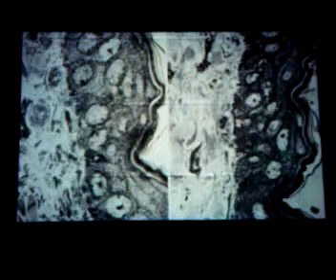We could talk layers, we could talk cells, we could talk all kinds of different things off of this section. Just some EM pictures, and as I told you, this actually is a stereo pair, and if you look at them kind of this way, see this region right here is the same region that's up here. If you cross your eyes the right way and you turn your head just right, you can get this in 3 dimensions. That's what stereo pairs are useful for, but it just shows you the stratum germinativum and then the layers going up. This is the stratum granulosum, and this one does not have a stratum lucidum because this is the cornified layer. That's what the granulosum is here.